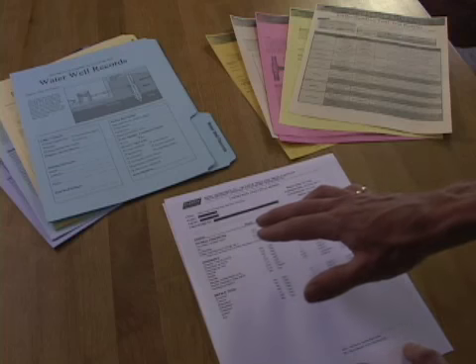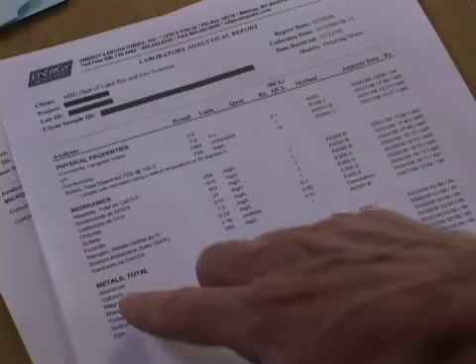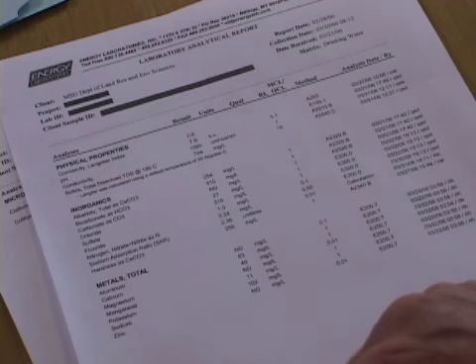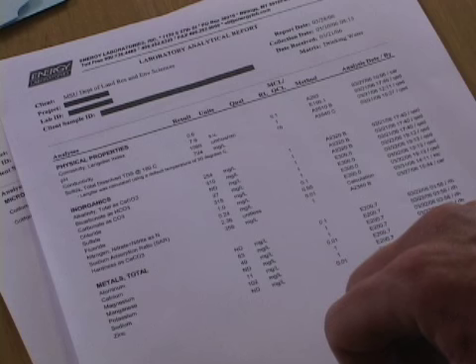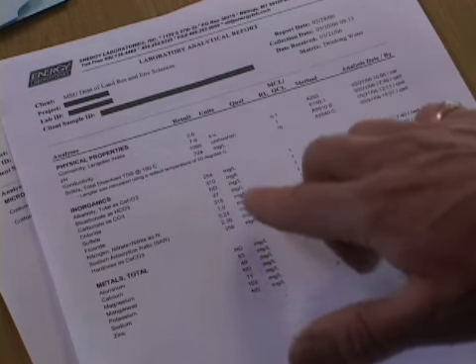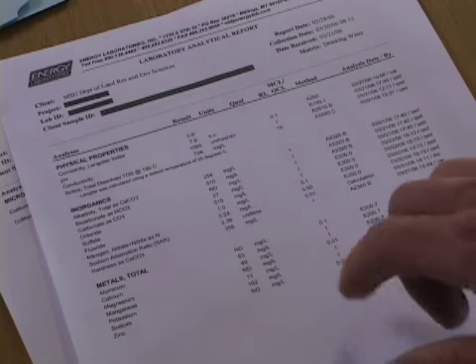After we've received our results from the lab, the next step is understanding what these numbers mean. So looking at our lab result here, we have a column on the left-hand side which lists the parameters that we tested for. Then we have a results column which indicates what they found in the sample. They have a units column which indicates what they're reporting it in. Milligrams per liter is a typical number. That's used interchangeably with parts per million in a lot of cases. There's also a column for the reporting limit, which is basically the accuracy of the test.